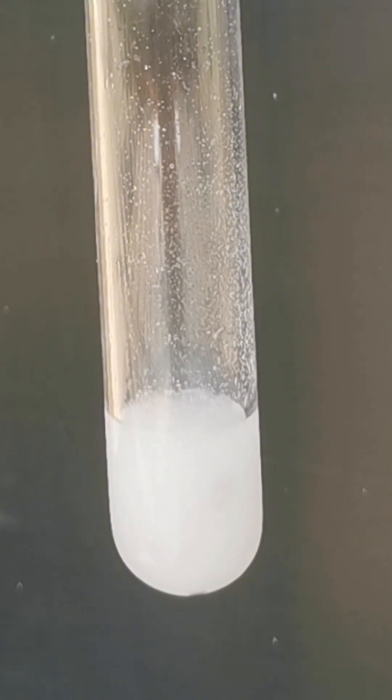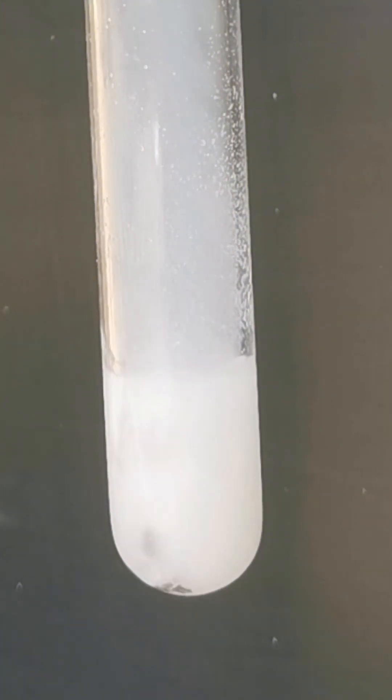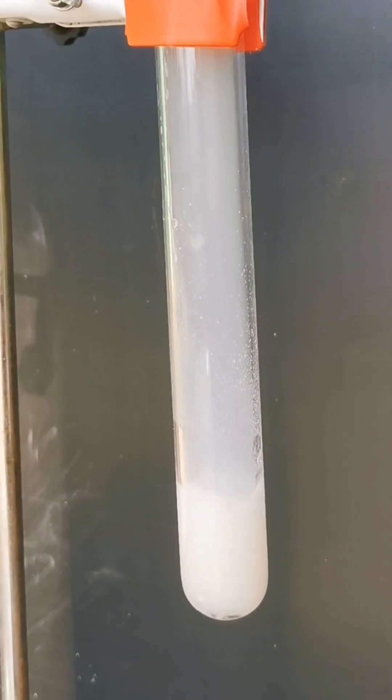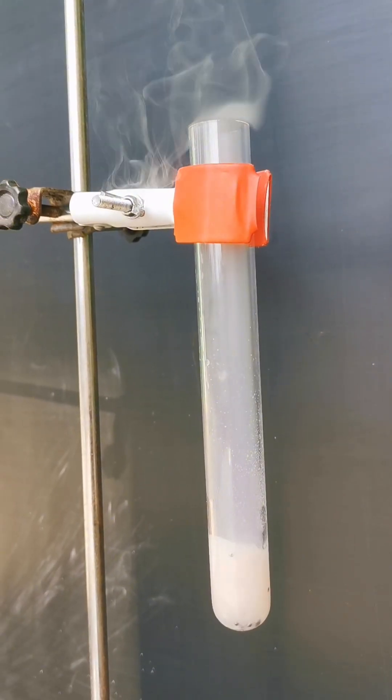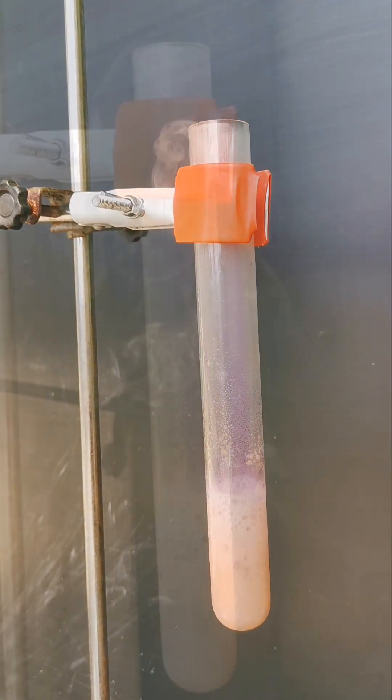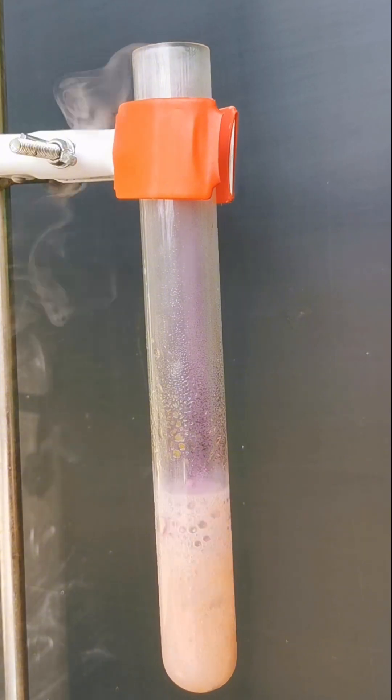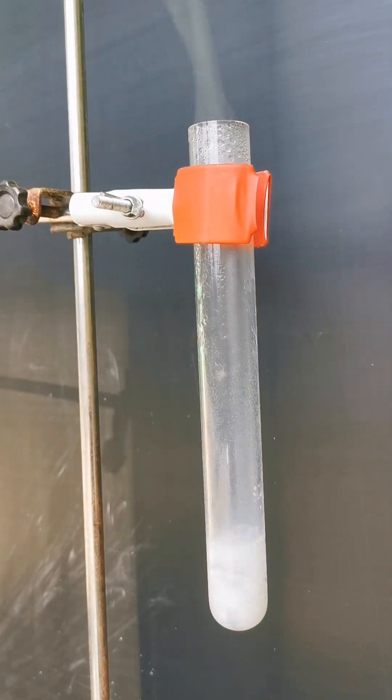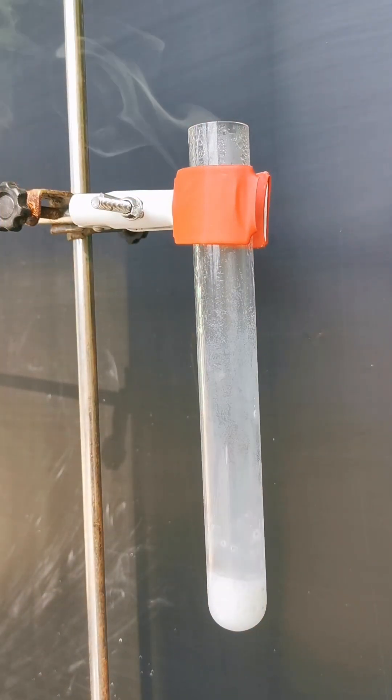And heating this solution. Some iodine vapors appeared in the test tube. But in the end, water vapor pushes iodine vapor out of the test tube.